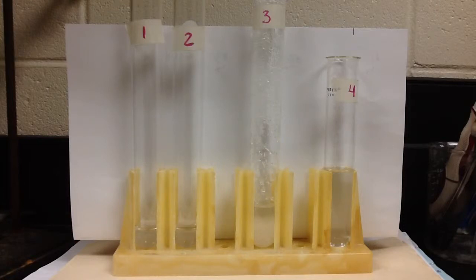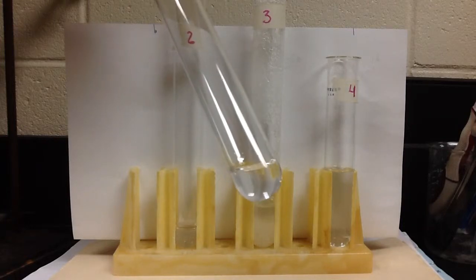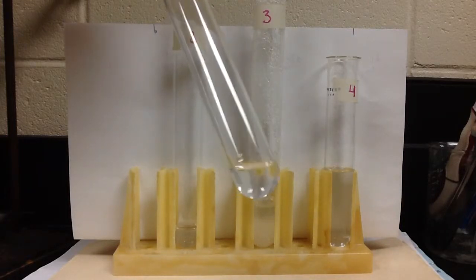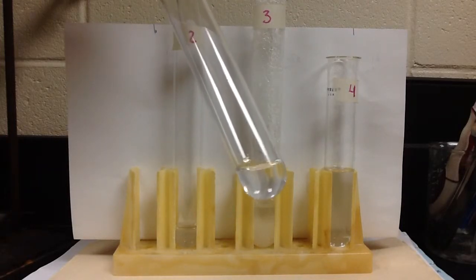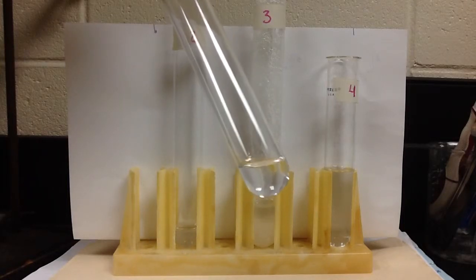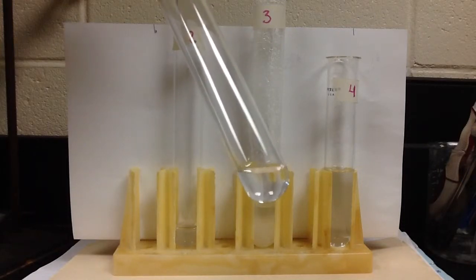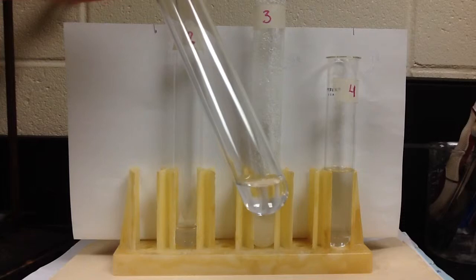Now, at that point, what we have is a clear solution where everything dissolved in it. When you have a clear solution like this, it's possible that we reached the saturation point, meaning that we might have reached the exact amount of solute that can dissolve in a certain amount of water at a certain temperature.